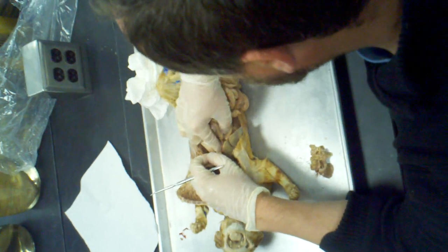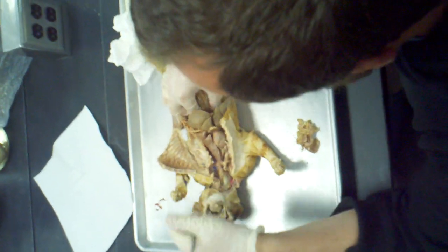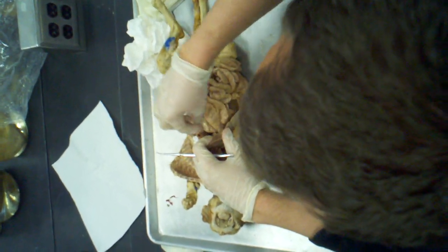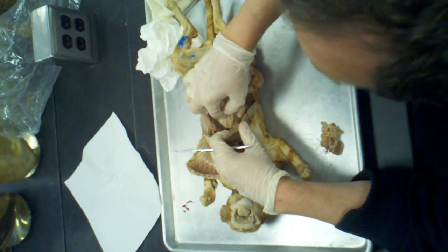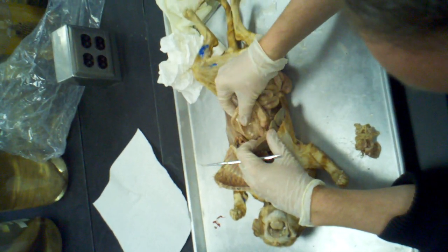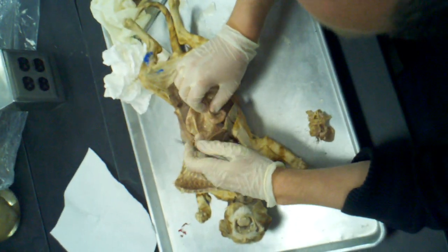The stomach, when it comes out of the diaphragm, of course, it's really hard to see the esophagus, but as soon as it turns into the stomach, this first part is known as the cardia. Once it starts widening, that first part, when it widens, is known as the fundus. And the main body of the stomach, when I hold the main stomach here, is known as the corpus, Latin for body.